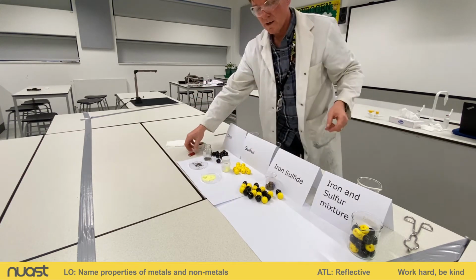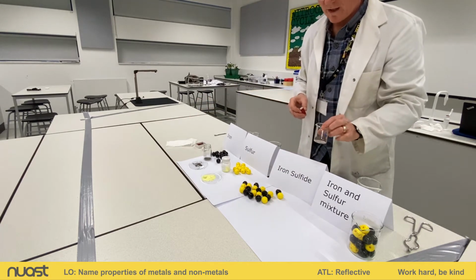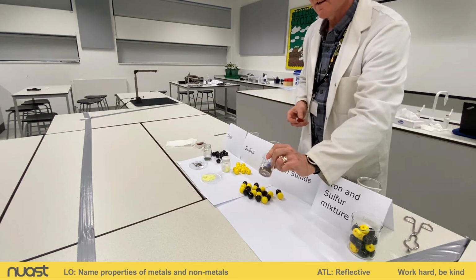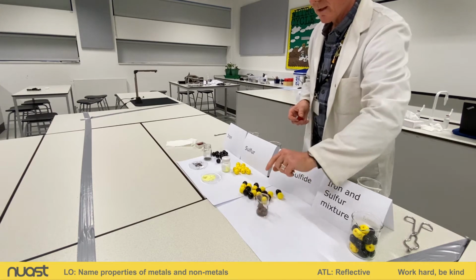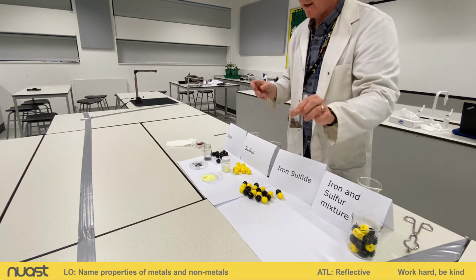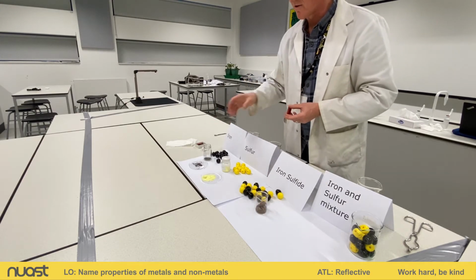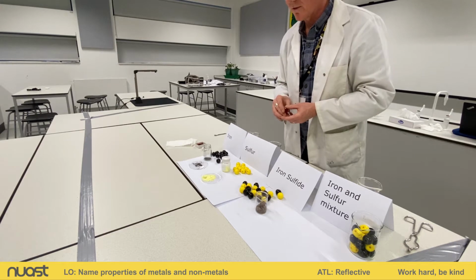Okay, and let's look at our last substance here. We have iron sulfide. All right, you can see, first of all, how different it is. We've got a brown solid here. All right, so our iron metal was a kind of a grey, black, silvery solid.